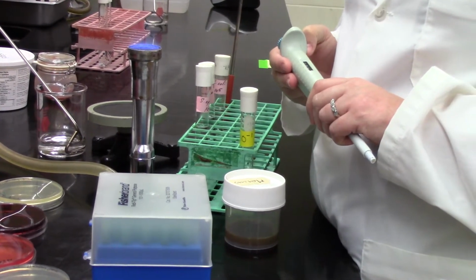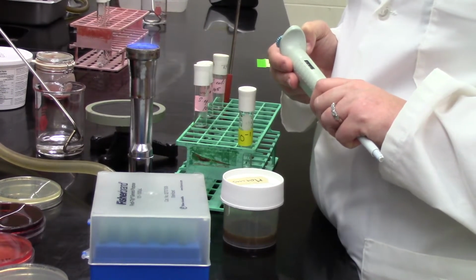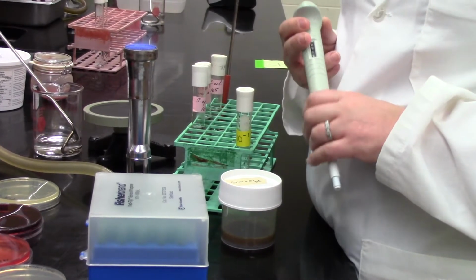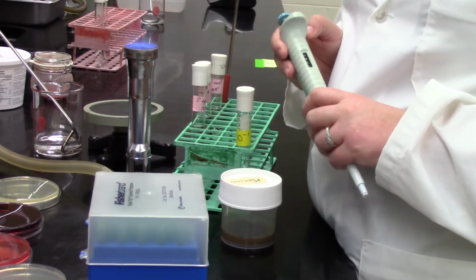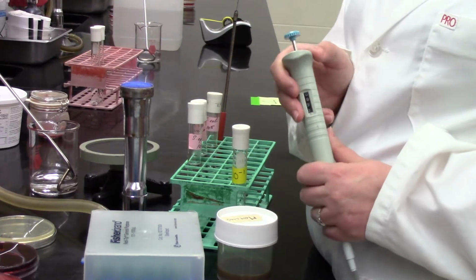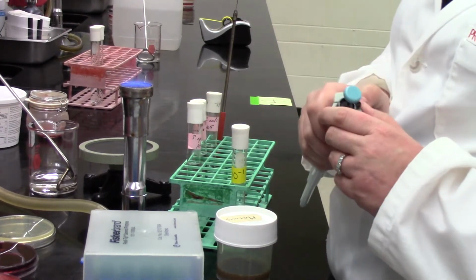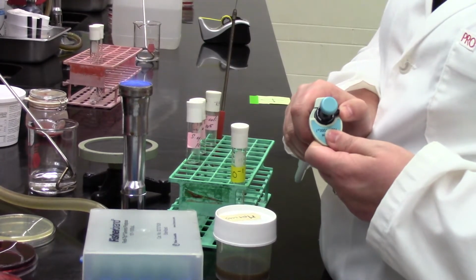But if you dilute it a bit, that's going to let us see colonies, or just reduce that lawn of bacteria to a point where we can get a better idea of what's going on on those selective and differential media plates. So Sabrina's going to start with a tenfold dilution, also called, as we discussed in lecture or in the virtual lab series, a 10 to the -1 dilution or a tenfold dilution.